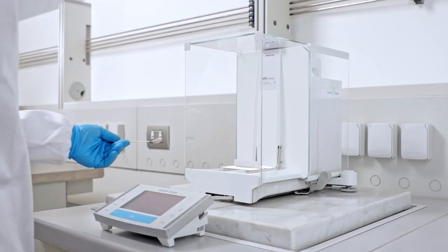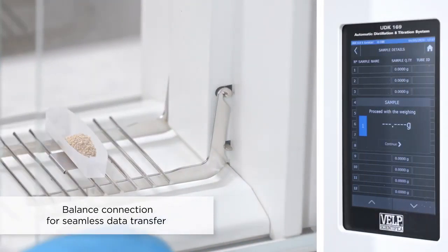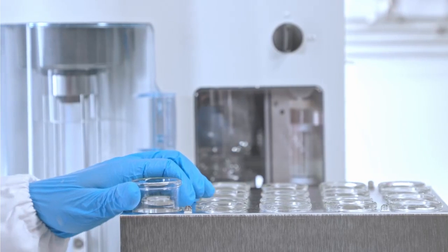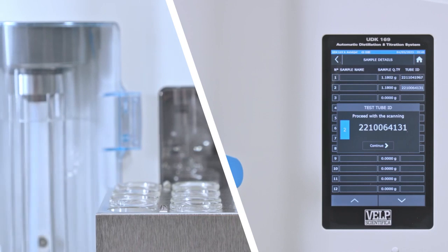To start the analysis, homogenize the sample and transfer it into a VELP test tube. Connect the UDK169 to a balance for a seamless data transfer. The optional barcode reader simplifies data management and speeds up the analysis preparation, avoiding transcription errors.